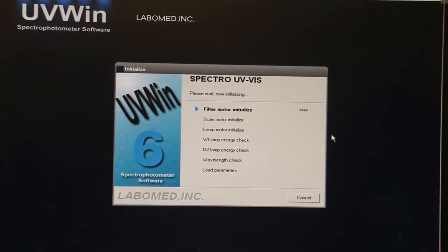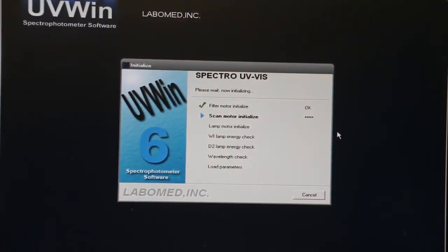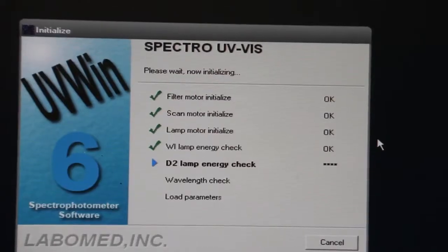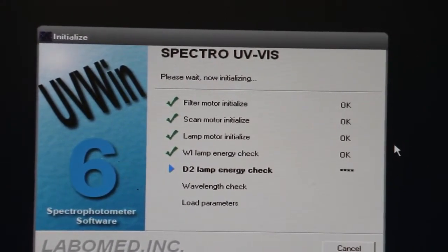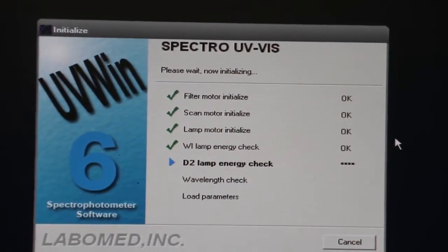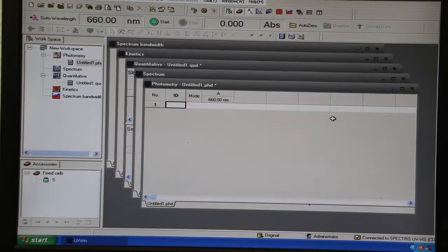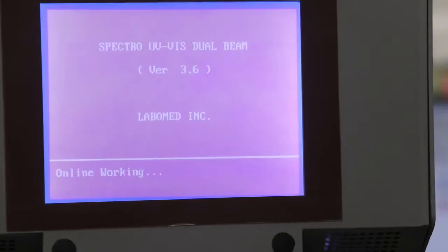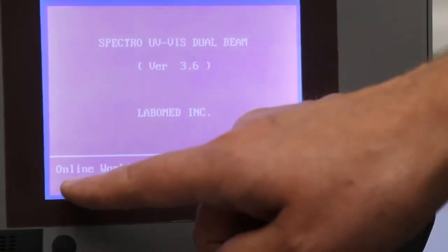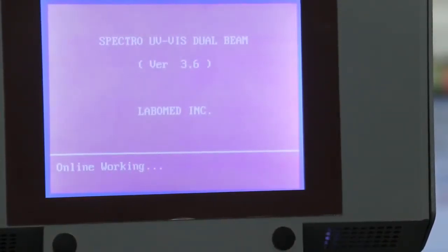Once you've made the connection, the machine will then run a self-test that is driven by the computer. In this initialization test, it will show you that each section is okay. If it doesn't show okay, there's something wrong with the unit. Now the Spectro is under control by the PC. You can use the PC to run all your tests. Now that the machine has given the message online working, you know that the PC is communicating with the unit.